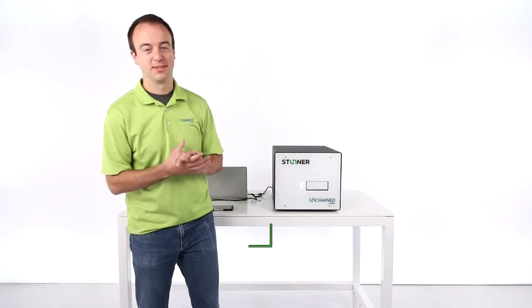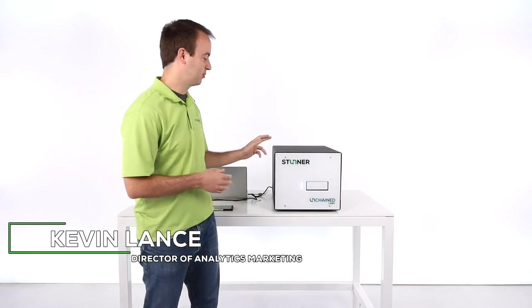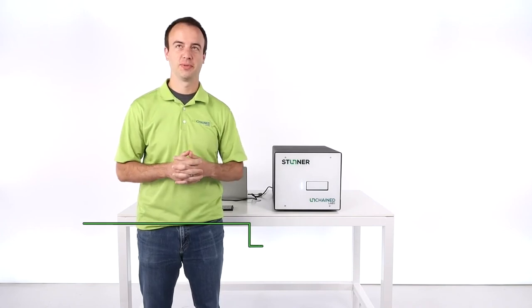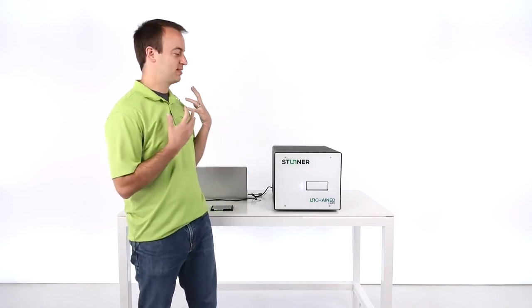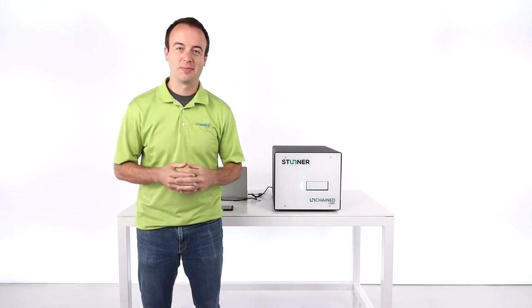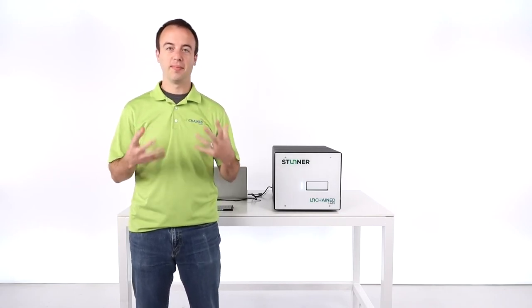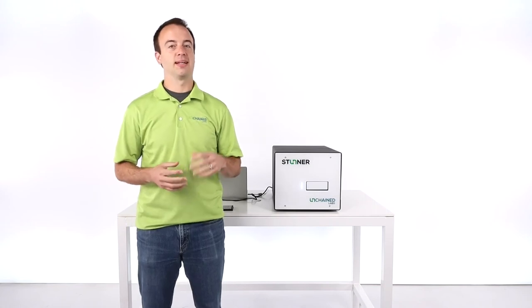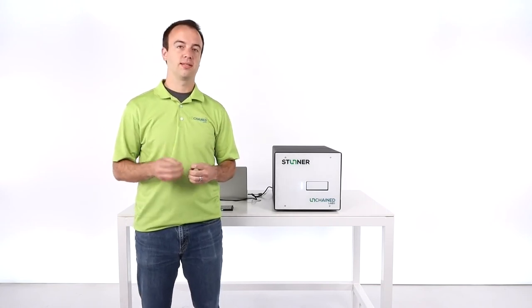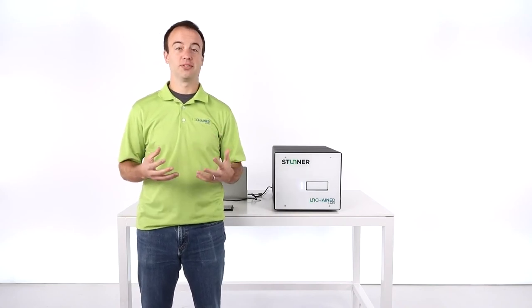All right, thanks for that introduction, Andre. Today I'll be taking you through Stunner, and what Stunner can do as the ultimate AAV gene therapy tool. Stunner is the way to get the most AAV data possible out of just two microliters of sample. From that tiny sample, you're going to get a really accurate and precise read on capsid titer, size and aggregation of your sample, and then empty-full ratio as well.